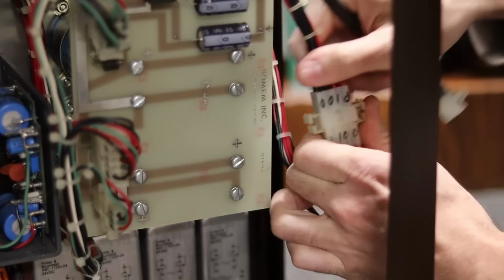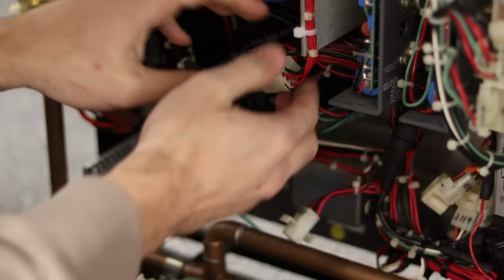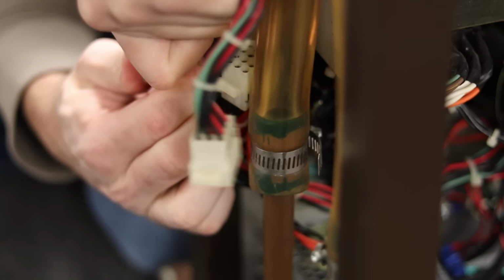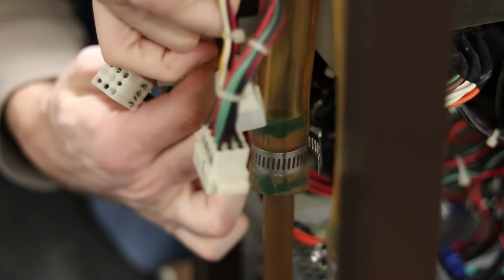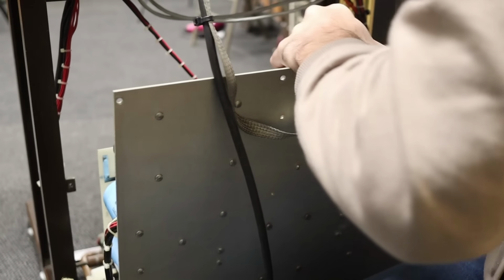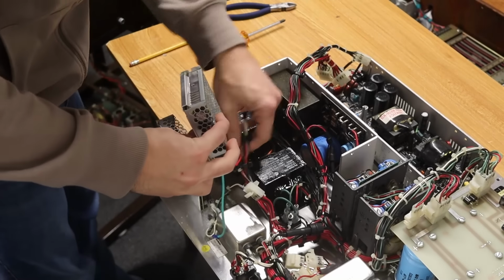To get the power supply out, I'll disconnect 2 connectors on the right side, then 2 more connectors in the middle, and 4 more connectors over on the left side. Fortunately, I've done this so many times, everything comes undone pretty easily. Then there are like, I don't know, 12 screws around the periphery, and with those removed, the whole thing comes out. Over on the bench, I'm thinking I'll slip the extra 5 volt supply in like this.